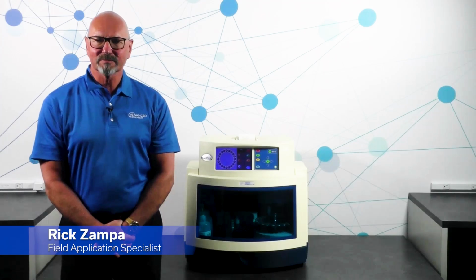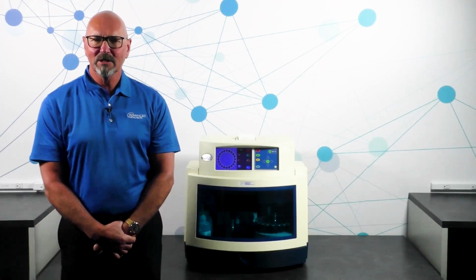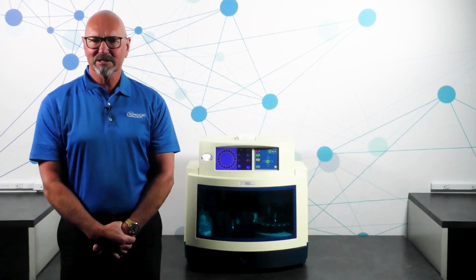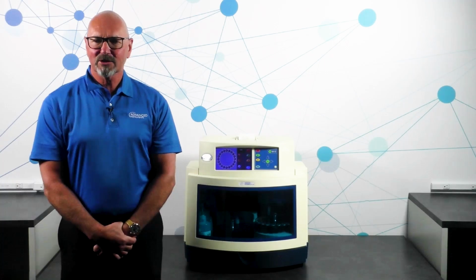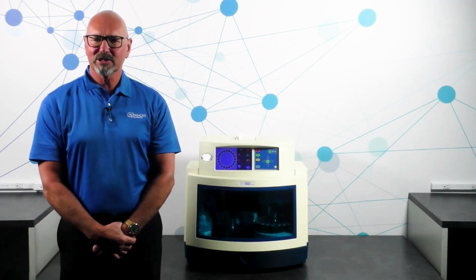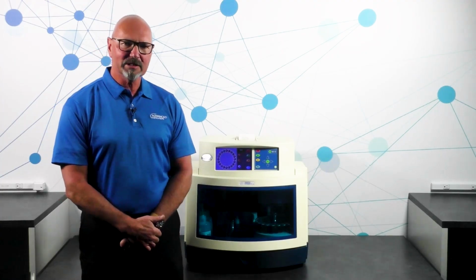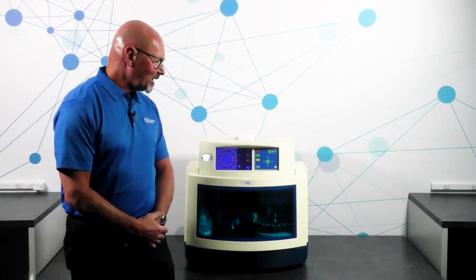Hello and welcome. Today we're going to talk about the A2O multi-sample osmometer and the OsmoTECH HT automated micro-osmometer. You may be familiar with these instruments, but today we're going to show you just how one is more suited for the GLP and GMP environments. Since we're talking about GLP and GMP environments, we also need to talk about data management. So let's take a look at the A2O multi-sample osmometer.